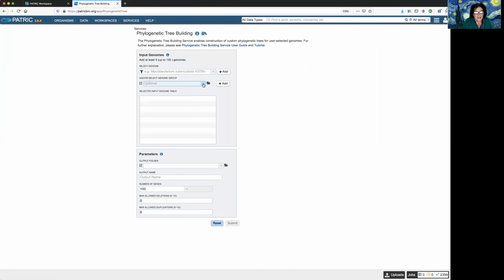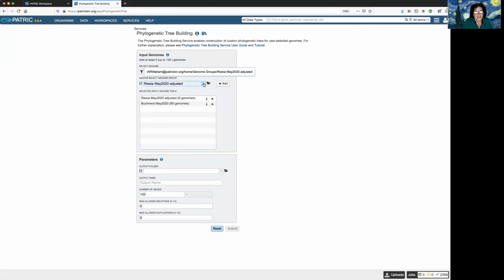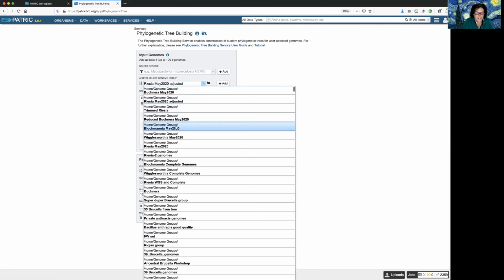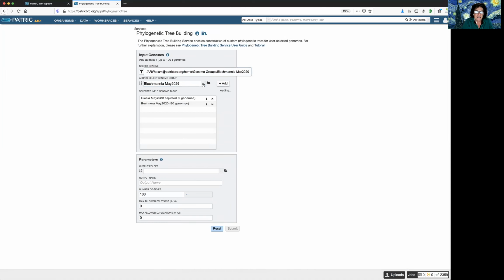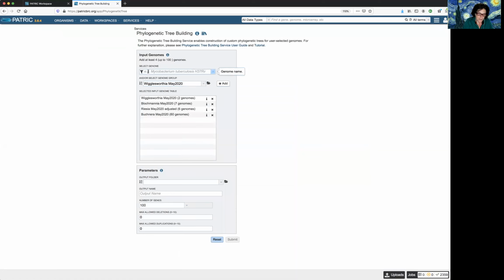Tree alignment. And then this time, here's my new Buchnera. Add that. Here's my adjusted Riesia. Add that. There's our old friend Blochmannia. Add that. And Wigglesworthia. Who could forget Wigglesworthia? Not only the insect physiologist, but also the endosymbionts of the tsetse fly. Let's add that. And remember, we had my private genome, which was a Wigglesworthia, because I am a fan. The lock sign indicates a private genome, and add that.